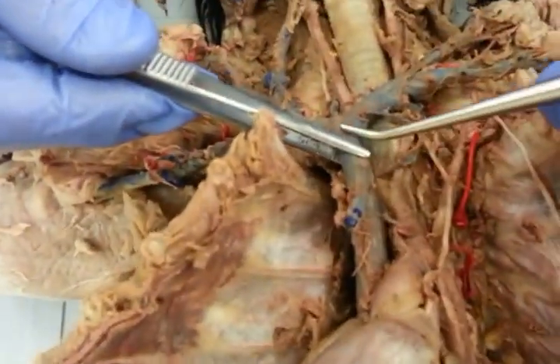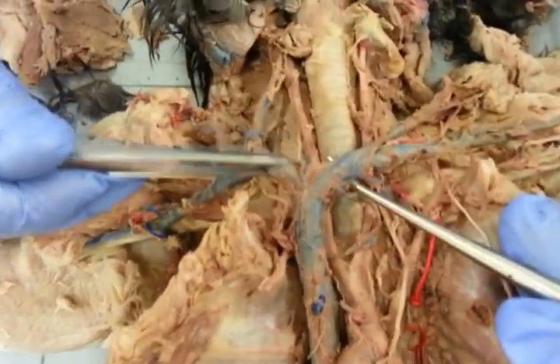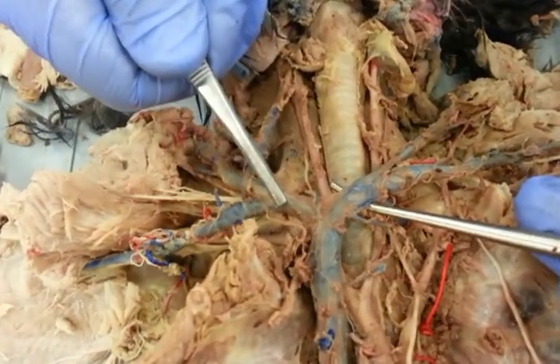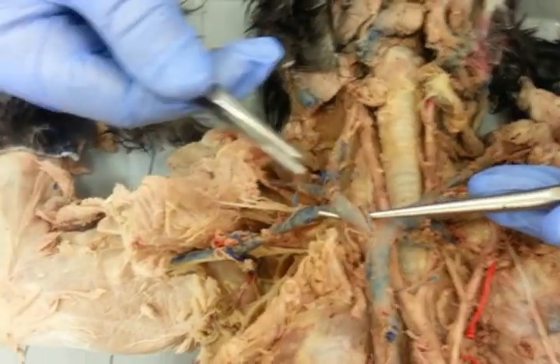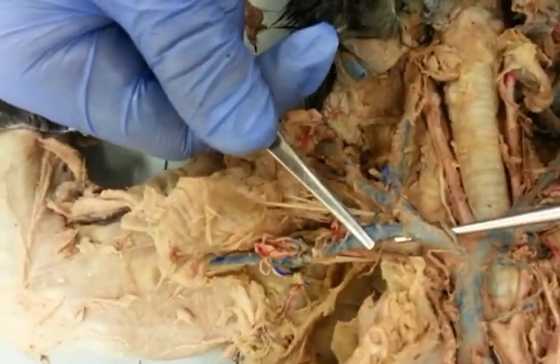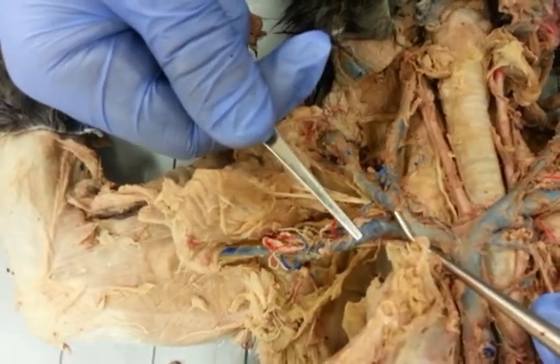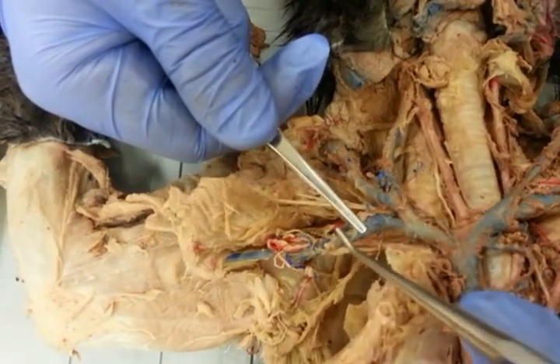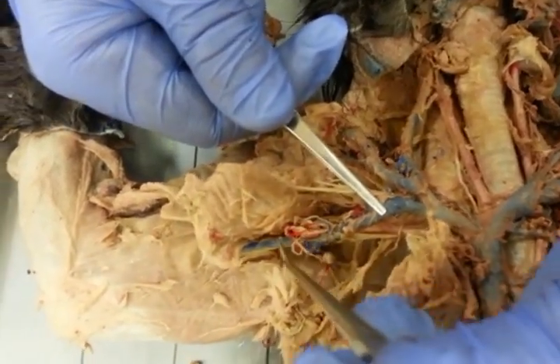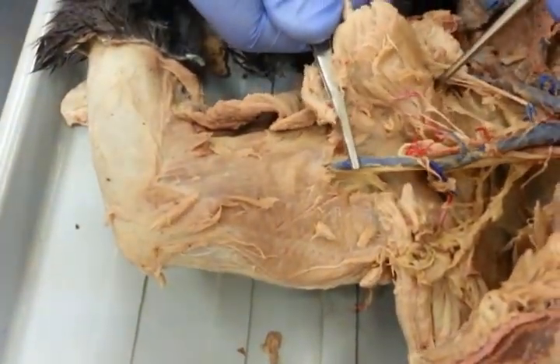All right. So back to the vessels. We have the cranial vena cava, and unlike the arteries on the vena cava, we have a right and left brachiocephalic. So these two segments right here are right brachiocephalic, left brachiocephalic. Right brachiocephalic is going to bifurcate again into this small portion, which is less than a centimeter long. That's going to be right subclavian. So just this centimeter is going to be right subclavian. Right subclavian turns into axillary, and then axillary is going to turn into brachial vein right there.